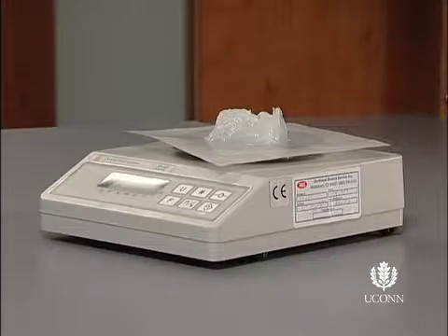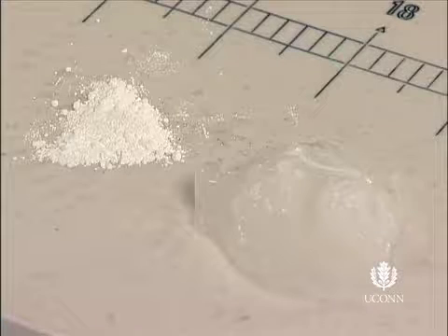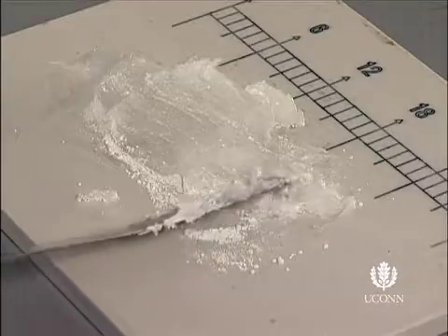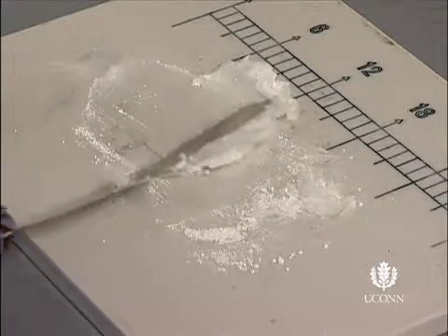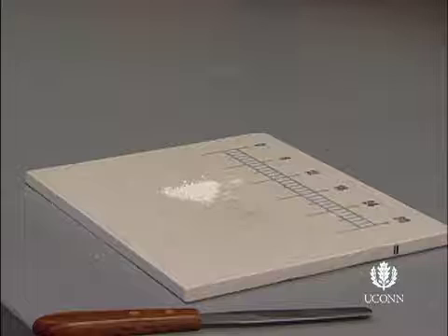Begin the lab by weighing out appropriate amounts of base and powdered components, including one or more drugs. Transfer the powders to the pill tile. As you will see, solids are not easily incorporated into ointment bases. Breaking up agglomerates in the powder of the solid dosage form is key when combining the powders and base. Incorporation of a levigating agent may prove useful.